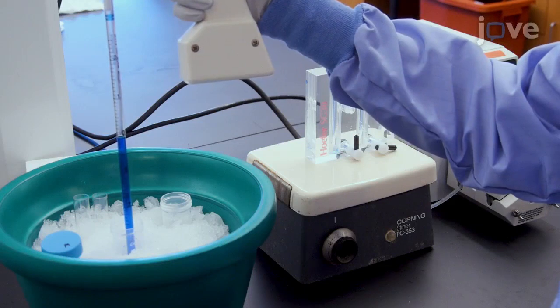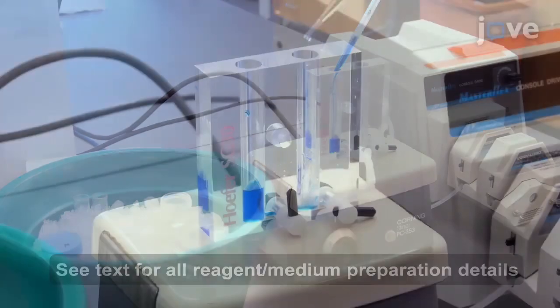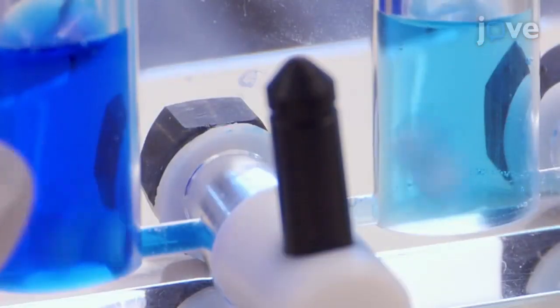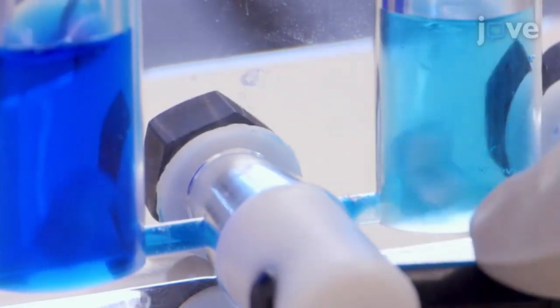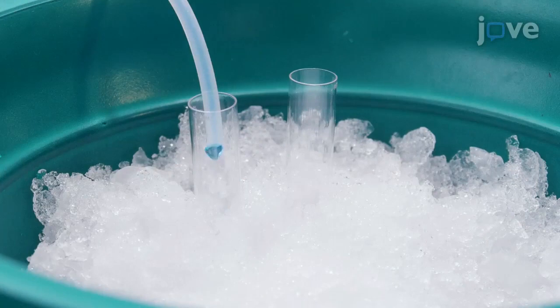On the day of the experiment, fill the left compartment of a gradient mixer with 5 milliliters of 15% sucrose gradient solution and fill the right compartment with 5 milliliters of 50% sucrose gradient solution. Open the tap and switch on the pump to stir the two small compartments with a magnetic stir, and use a tube linked to the second tap to allow the mixed sucrose solutions to flow into a single ultracentrifuge tube with thin walls on ice.